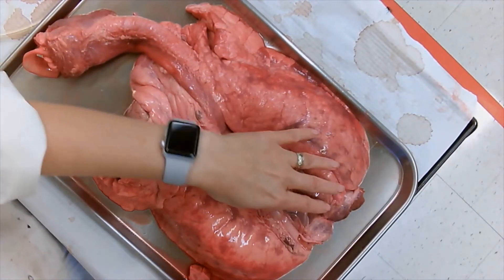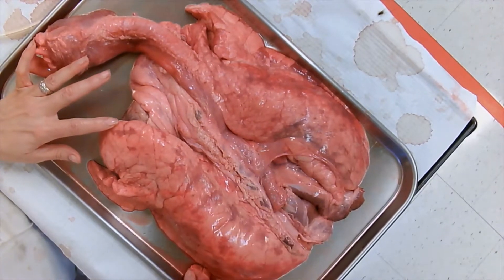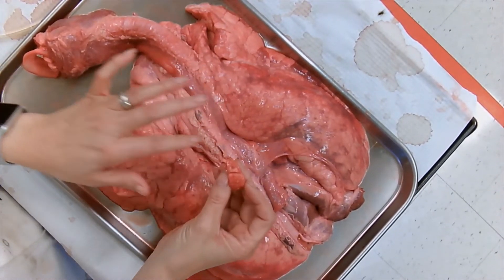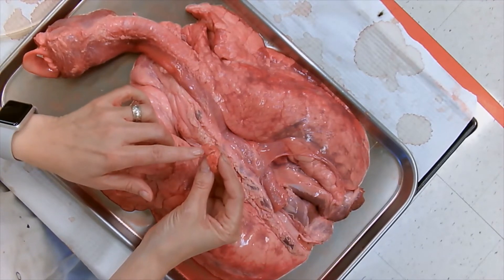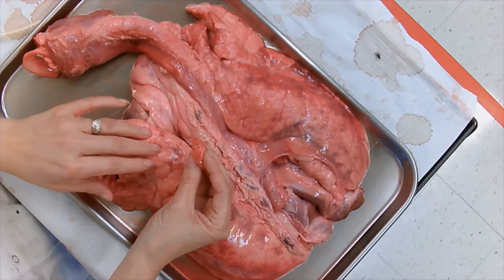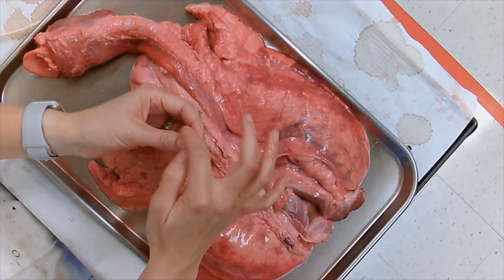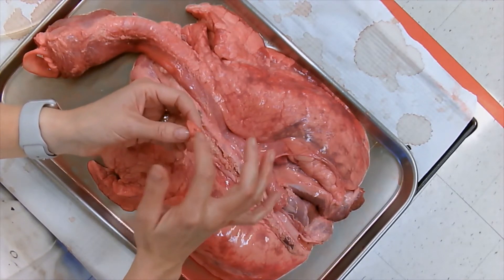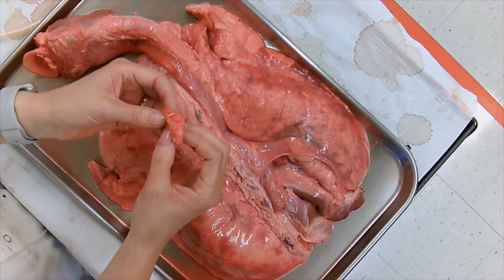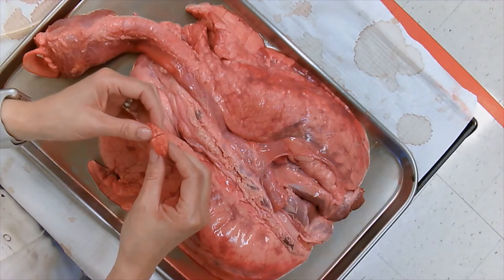Inside the lungs you have bronchioles pretty much everywhere. I have a little piece here where you can see there are tiny tiny little parts — those are the bronchioles. The bronchioles feed air into little sacs that have a lot of alveoli in them.